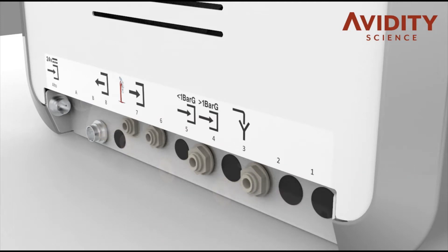Insert the power cable and lock into place by turning the collar clockwise.